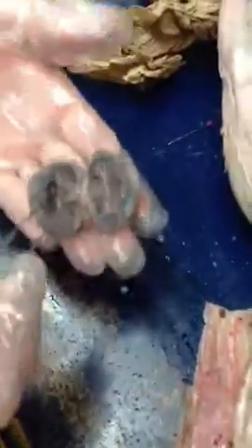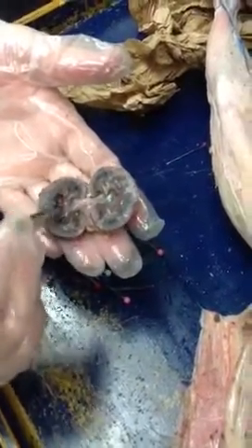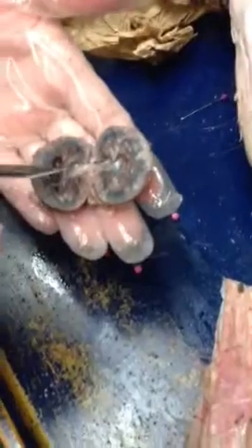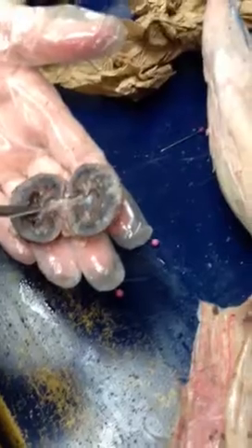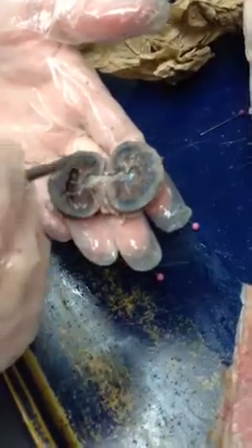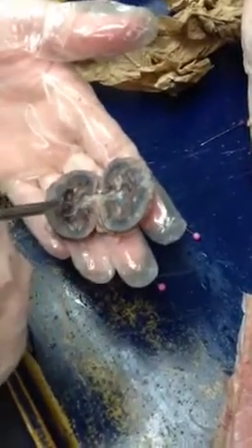Your arteries aren't in there, so I don't know what happened with the dye. Each little section is a renal pyramid, and the medulla. This shiny middle part is the renal pelvis. As best we can do, at the intersection of the renal pyramid and the renal pelvis, if we put the pin right there, that's the renal calyx. It says calyces on the sheet, but calyx is the singular. So: renal capsule on the outside, cortex, renal medulla, renal pyramids, renal pelvis, renal calyx.